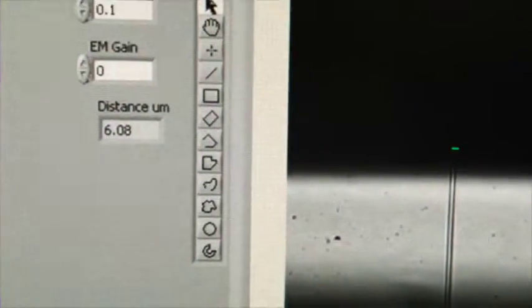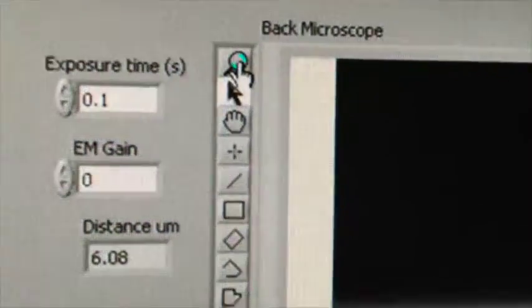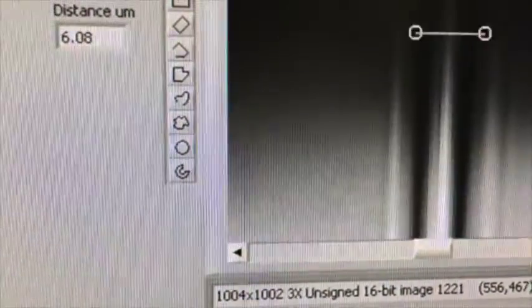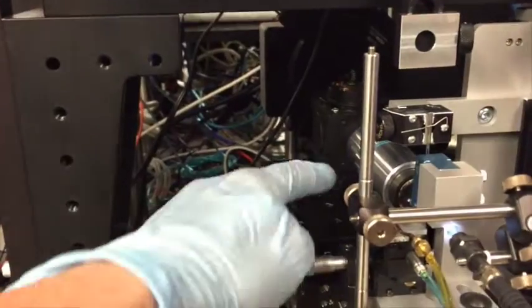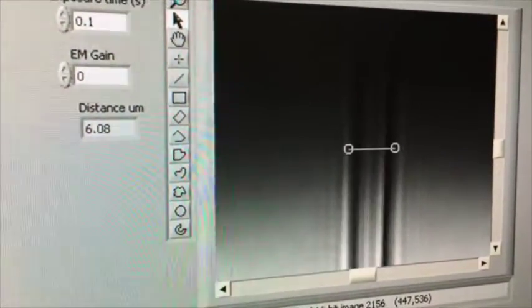I'm now going to click on this magnifying thing, and as I do that, I usually do it about 5 times. And I'm going to switch it over to the arrow and pull my measuring device over here. I'm now going to focus again. Focus is near the camera, so it's this one up here. Here's the camera, here's the focus for the camera. Bring this into focus, so I know where my edges are.